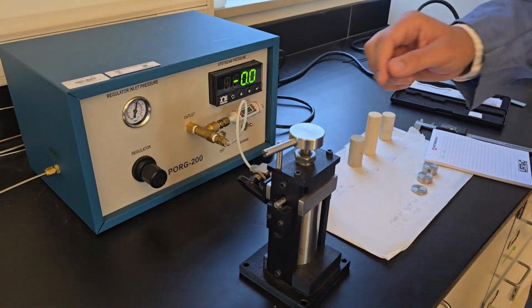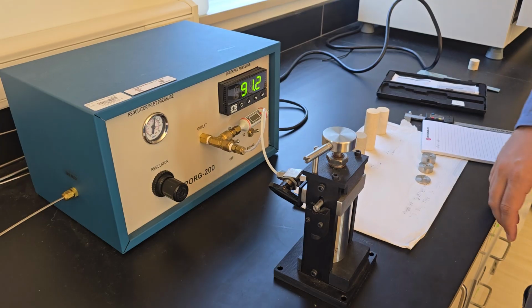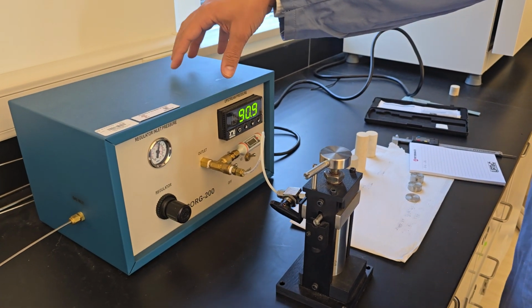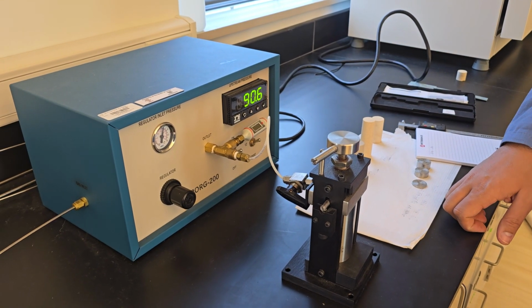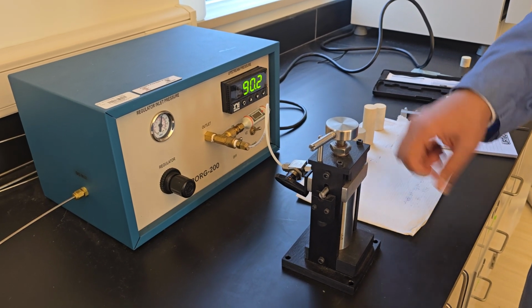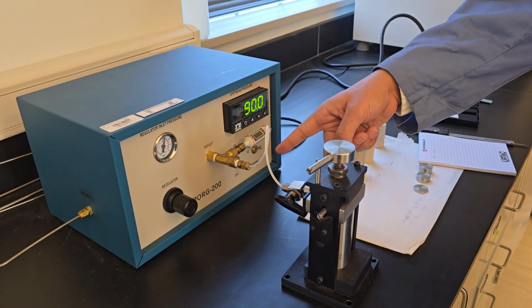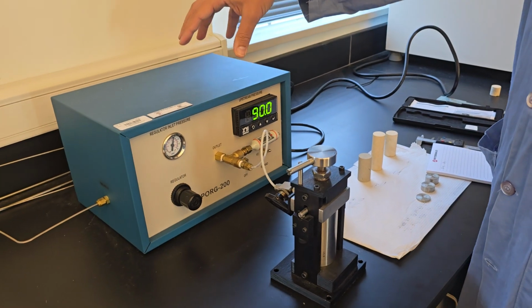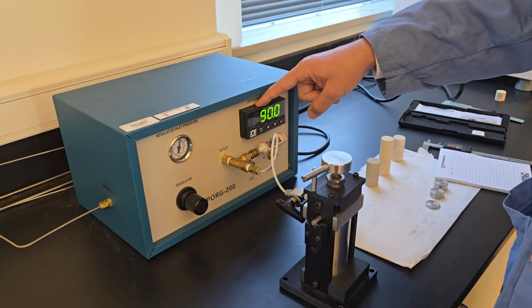So what I do, the first step is I open valve 1 to on to load the system with the pressure. So what happens here is the inlet pressure goes through our reference chamber inside there. And then I wait until the pressure stabilizes. Around 90 it should stabilize. And once it hits around 90, I'm going to close the first valve. So now the first valve is closed, which means the inlet gas is not connected to the reference anymore. So inside the reference chamber, I have 90 psi.